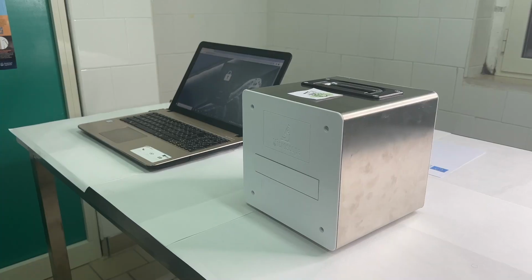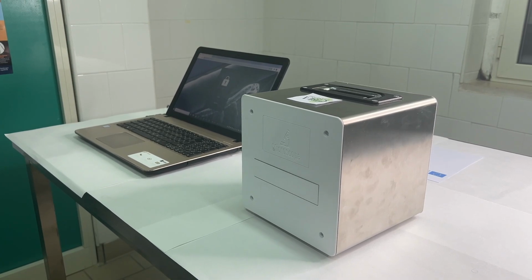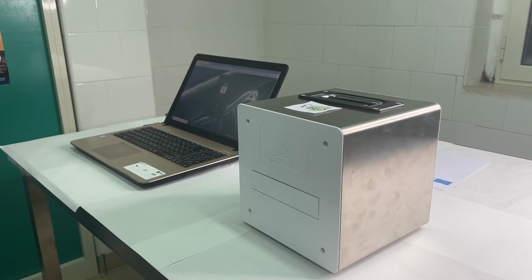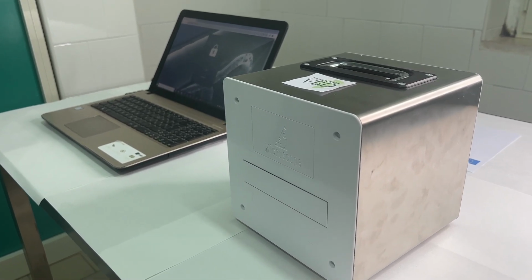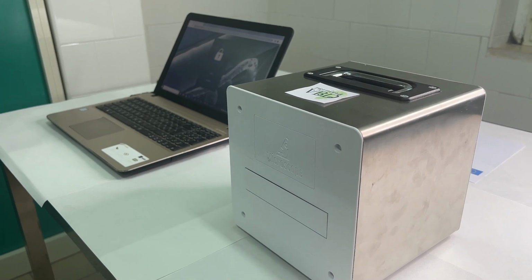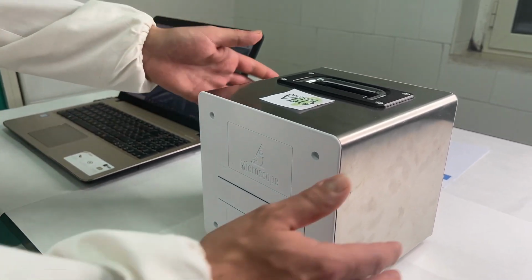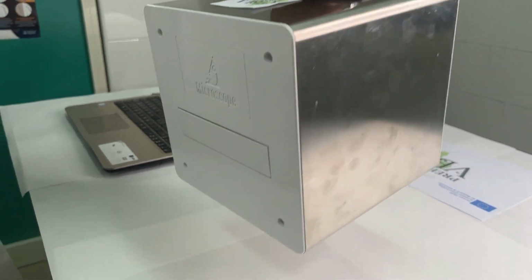Thank you. Welcome everybody. Now we continue with another practical demonstration on the Kubic FLOTAC Microscope, where Giuseppe and I will illustrate the operation steps of the KFM. The KFM, as the name suggests, is a cube, is compact and weighs only 4 kilograms.